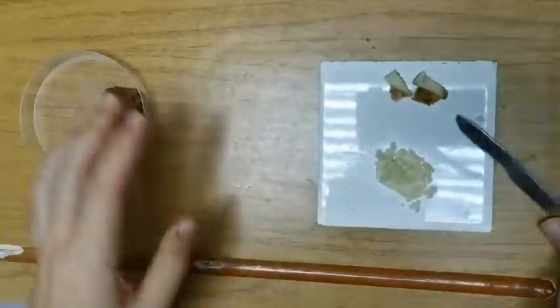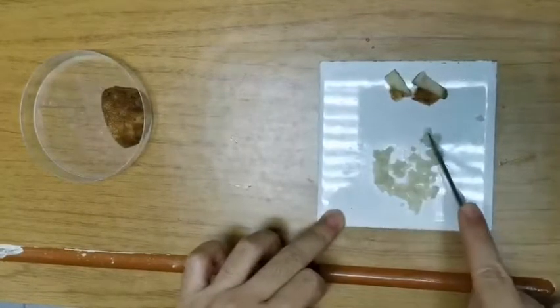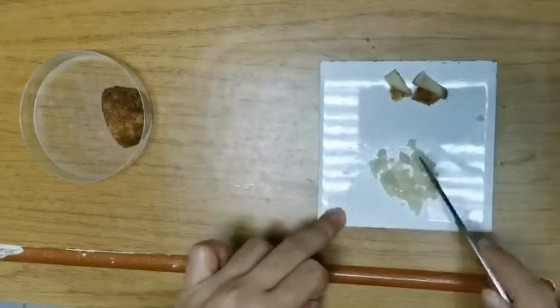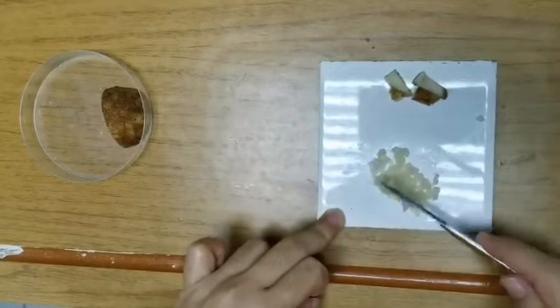So ideally, what we want is to cut the food specimen into very small pieces. Of course, you need to look at the time as well. You don't want to spend 15 minutes, half an hour just cutting food. So the idea here is we want to break the food into smaller pieces to increase the surface area.